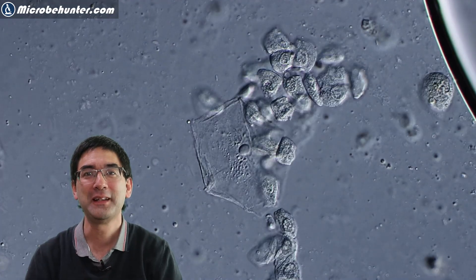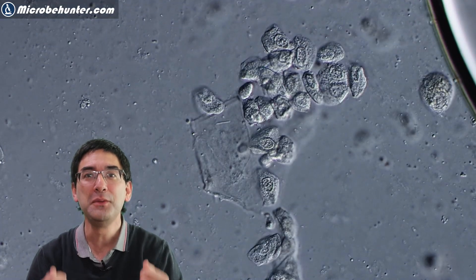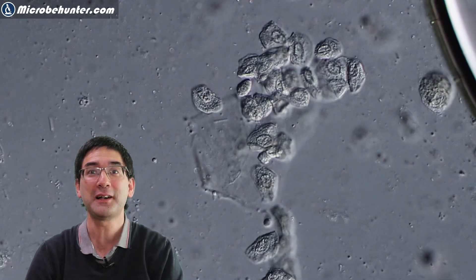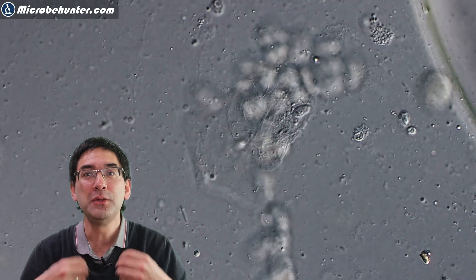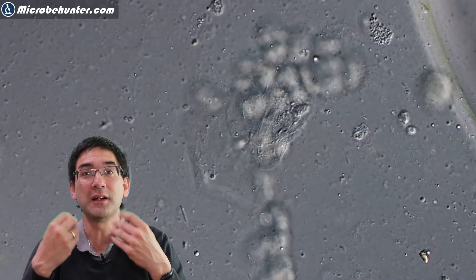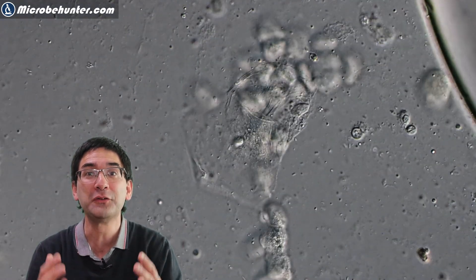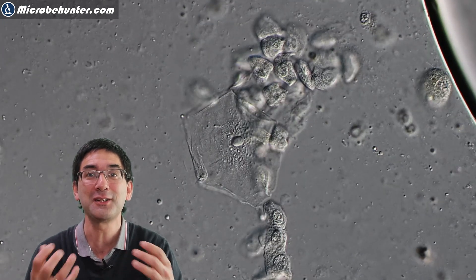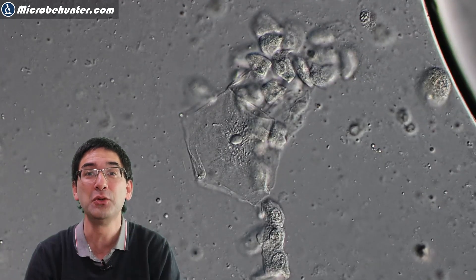MicrobeHunter here again, and today I'm going to put some mucus from my lungs under the microscope. As a matter of fact, here you can already see it. When you put some mucus from your lungs under the microscope, you're going to see, of course, a lot of dust and dirt, because the dust and dirt gets caught inside this mucus.